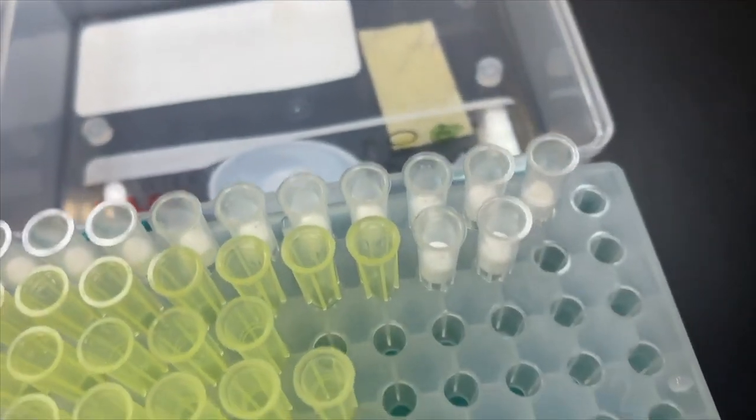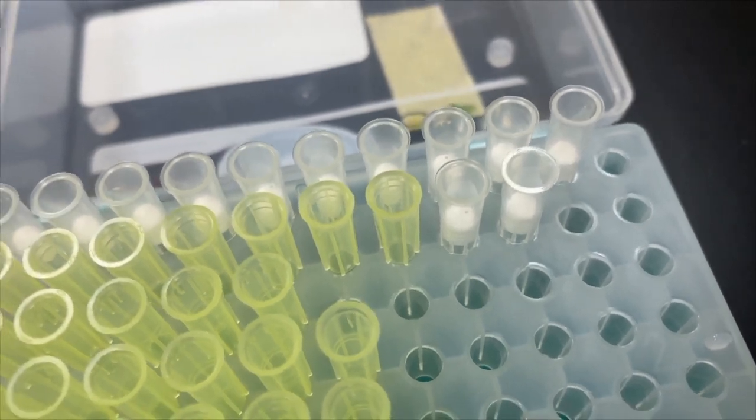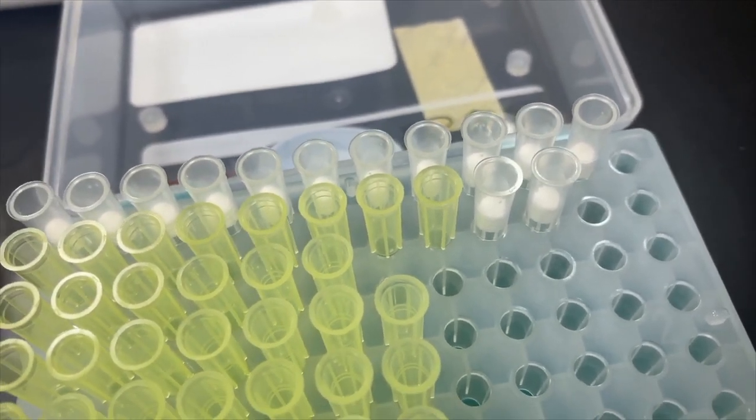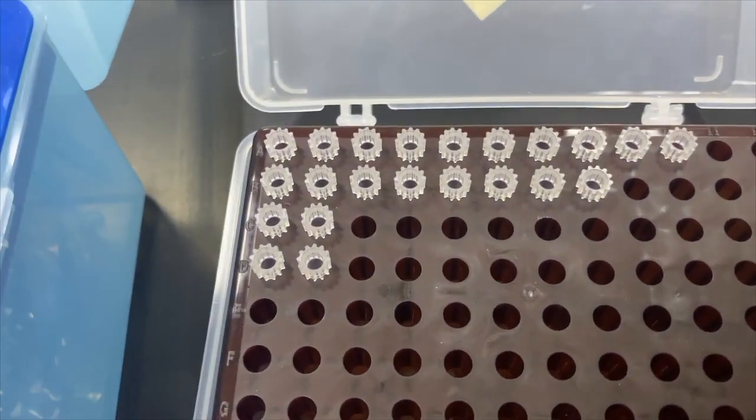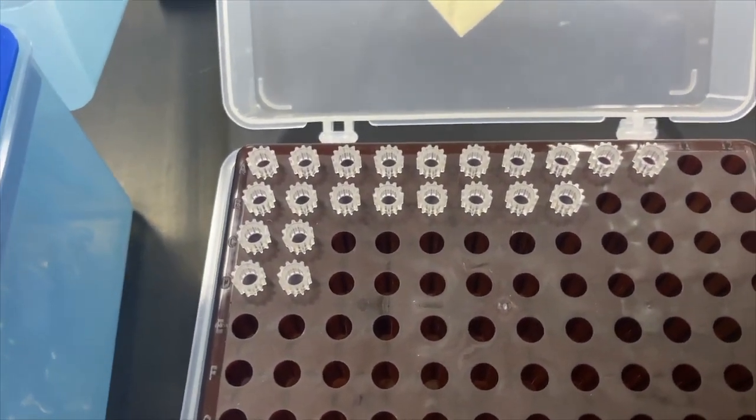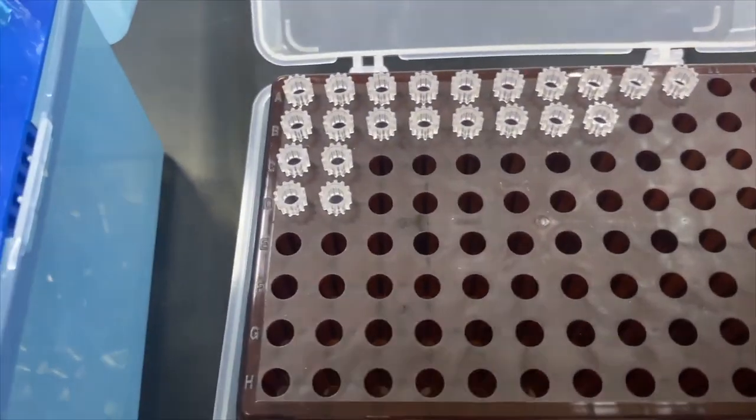But this white one, this white tip has the filter on the proximal side of the tips. And this one is for less than 10 microliter, this one, the green one. So, you have to use this kind of tips.